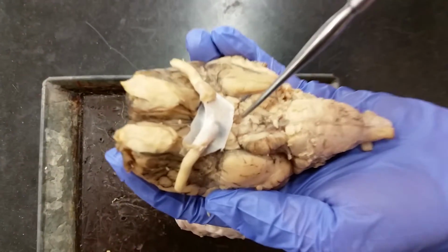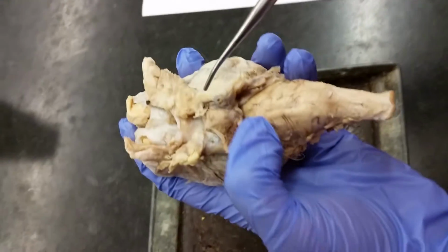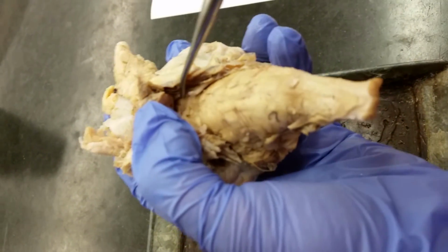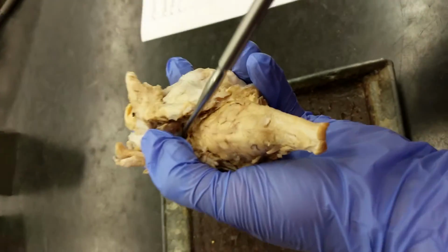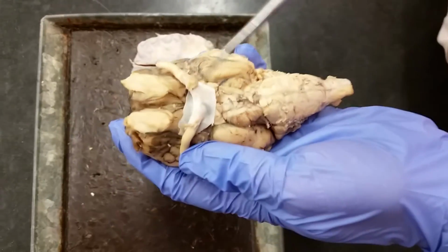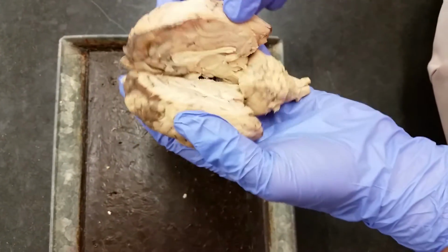The infundibular stalk is just behind that, and there's a little hole. So this is the infundibular stalk. Oh, and on this, we wanted to show you that it is up under here. Up under the pituitary gland. Sorry. So it's still attached. On this brain, the pituitary gland is still attached, and so the infundibular stalk is up under here. What most of you will see once you remove the pituitary, since that's not going to be on your test or your quiz, is the hole here. That's the infundibular stalk.